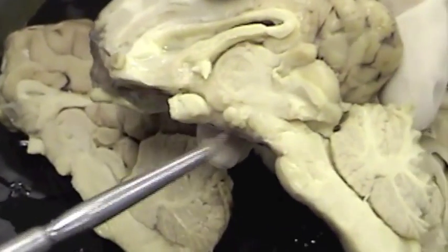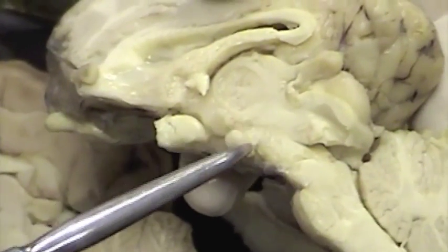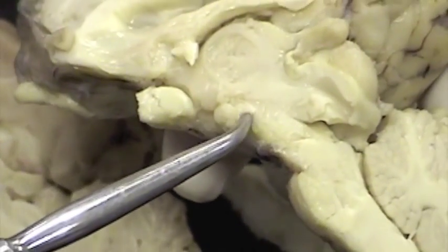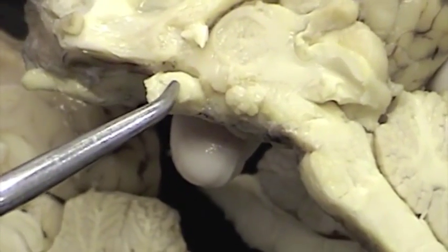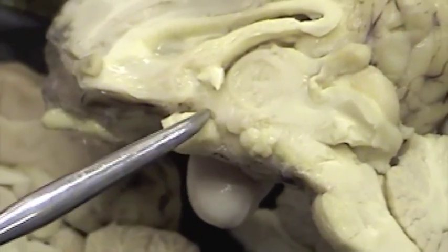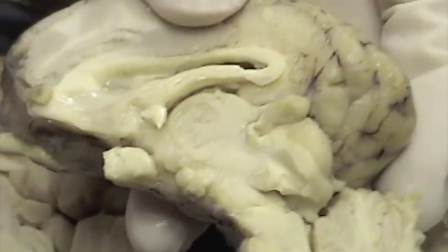Next we need to find the hypothalamus. The hypothalamus is seen pretty well on this sheep brain. It is inferior to the thalamus — here is the margin of the thalamus. The hypothalamus includes the mammillary body; there is a cut through the mammillary body, and it goes anterior to but not including the optic chiasma. Here is the optic chiasma. So the hypothalamus is outlined right here — a very important region of the brain.